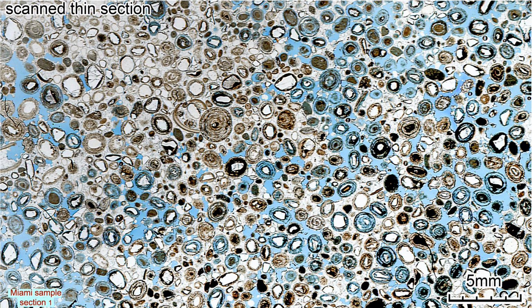Patches of oolite have their intergranular pores filled with calcite cement. Other patches have none. The calcite crystals at the contact between these patches have irregular margins caused by dissolution.